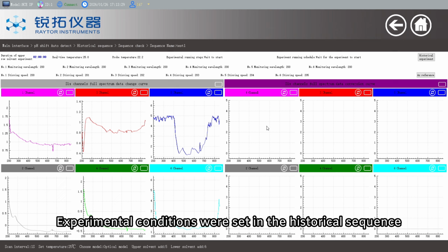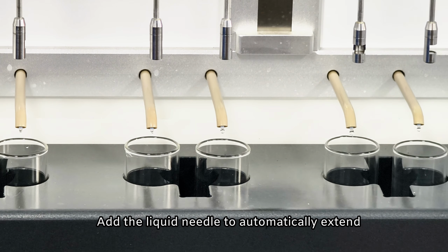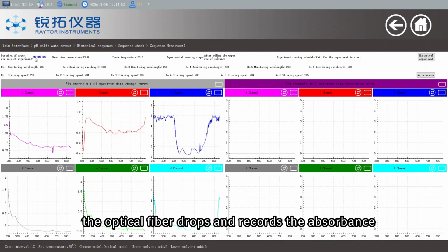Experimental conditions were set in the historical sequence. After the experiment began, wait for the first injection of the medium. The liquid adding needle automatically extends. Add the set volume of medium to the reaction vessel. After adding the medium, the optical fiber drops and records the absorbance.